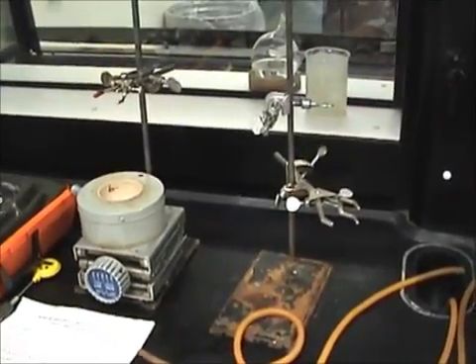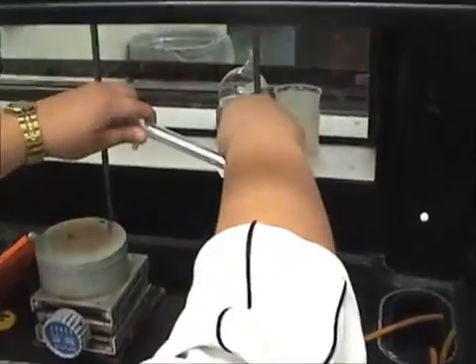Let's first set up the condenser tube. Make sure it is tightly clamped to the stand on the right.